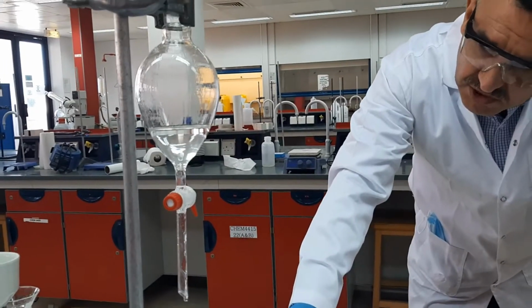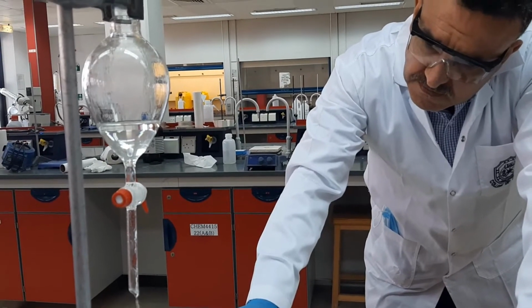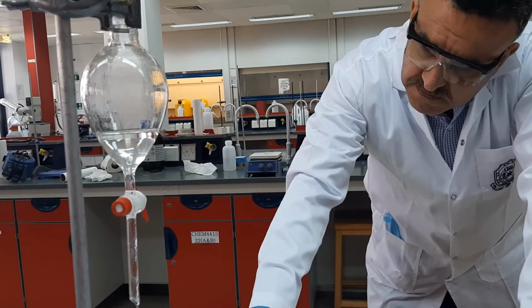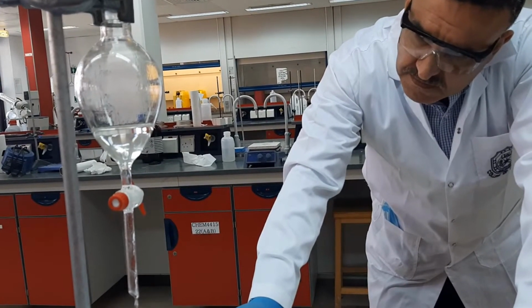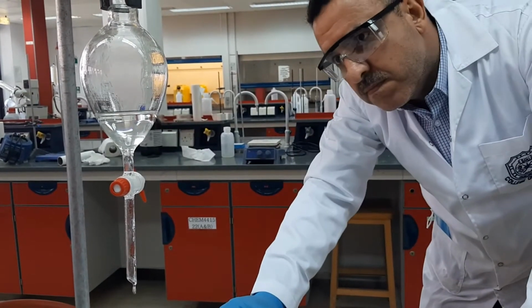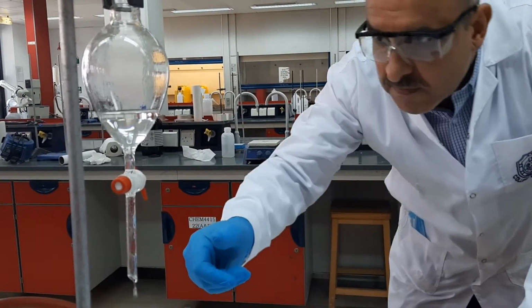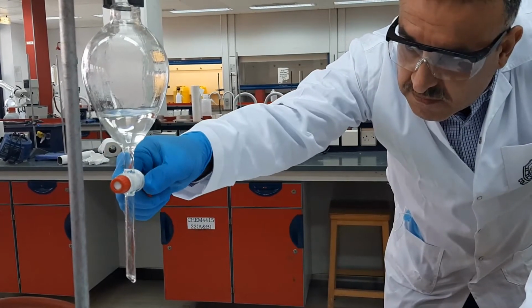I control the whole show nicely. See the layers right here.